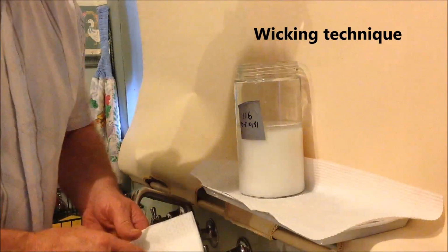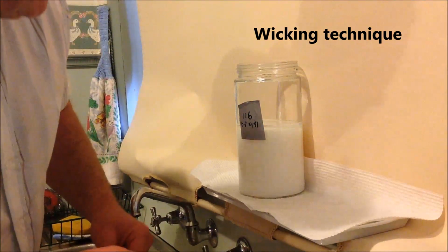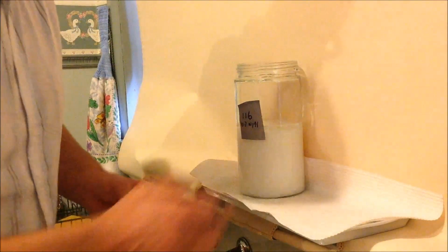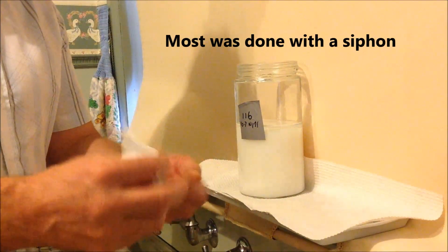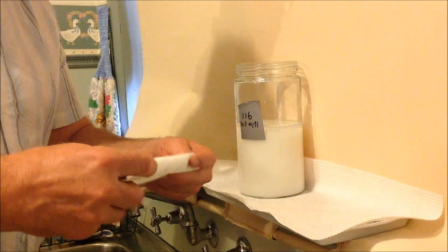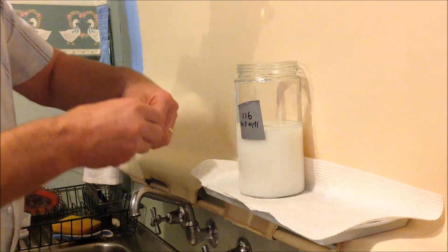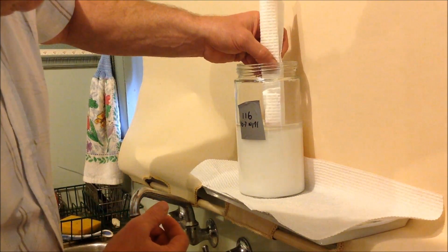The 3 washes are finished at 10.7. I could have continued to settle out a little bit longer, but it won't matter too much in this case. However, I will take off that last little bit of moisture, and a good way to do that is take a bit of regular kitchen towel and fold it and then roll it like this, and you'll find that if you just dip the end in that, you can use it as a wick and it will very quickly soak up.